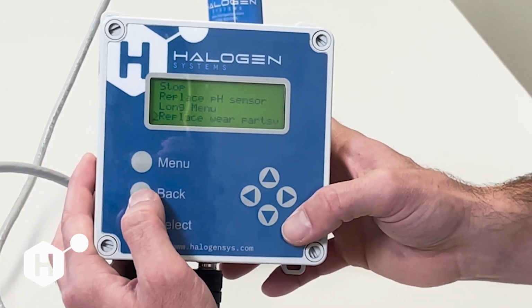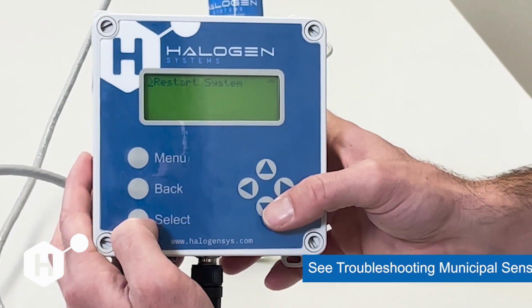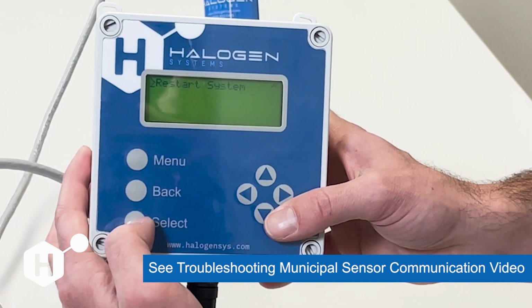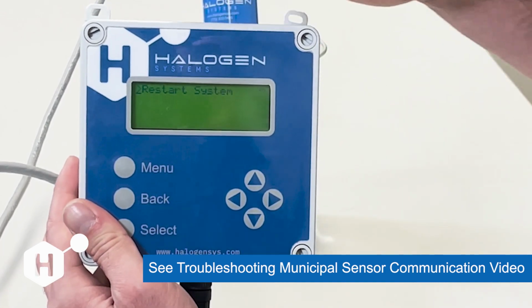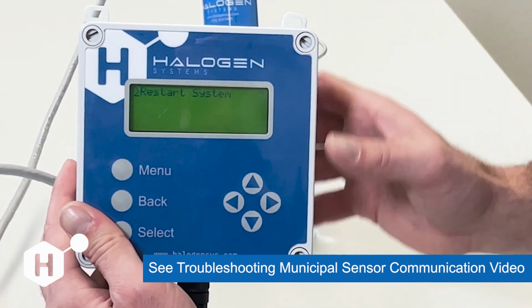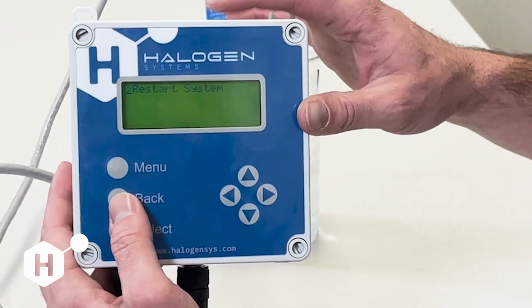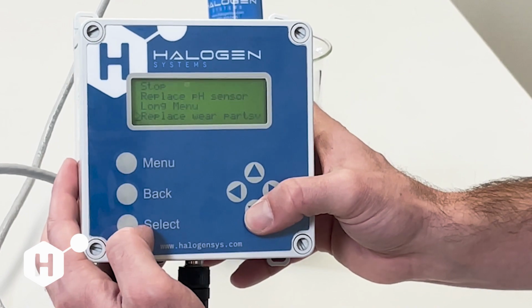And all the way down at the bottom, we have our restart system command, which I covered in some of our diagnostics videos earlier. It's going to hard reset the sensor as well as the display. So if you're having any errors, and you want to clear errors, that's also another good way to do that.